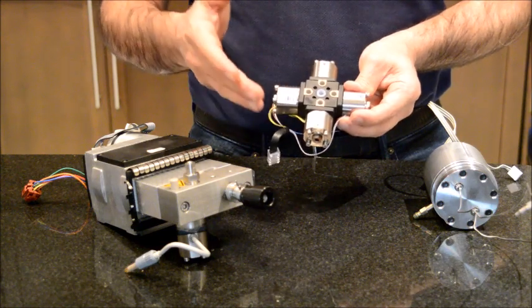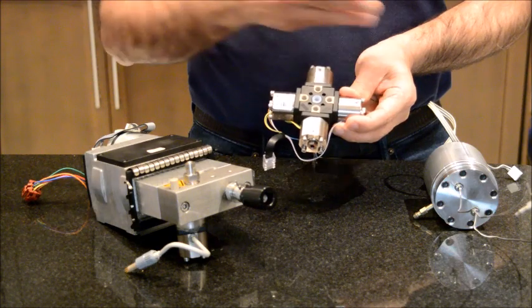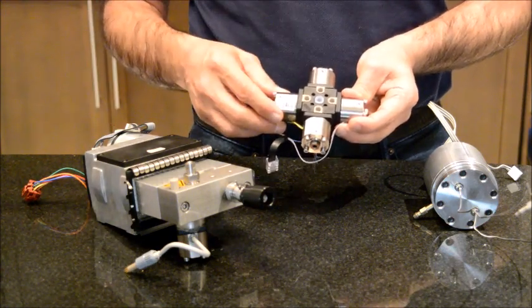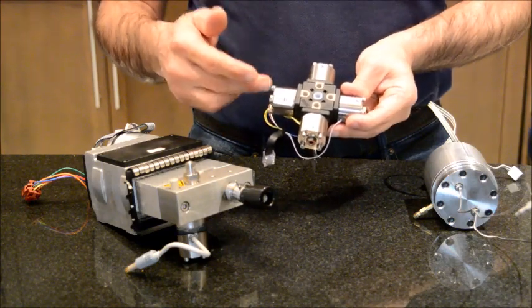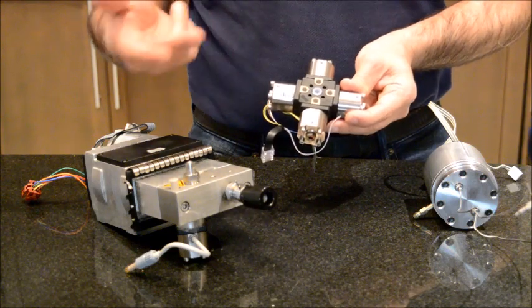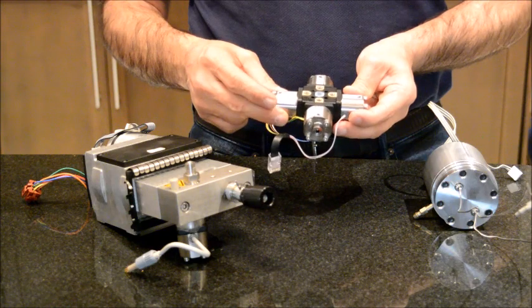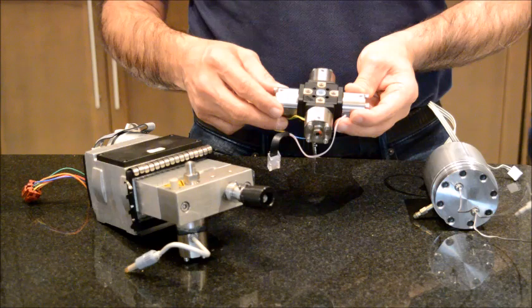Maybe there will be peaks too late or too early or in other places, and the problem could be because one of the solenoid valves, the components inside, is stuck, or the solenoid valve doesn't close or doesn't even open. Later in this video I will open up these solenoid valves, one of them at least, and I will show you how it looks like inside.